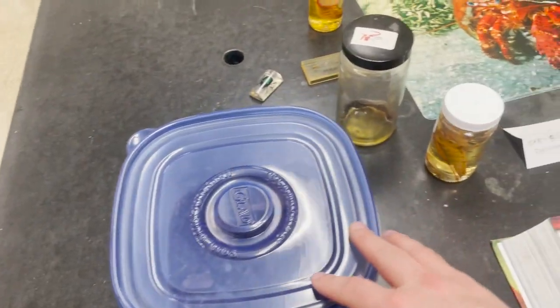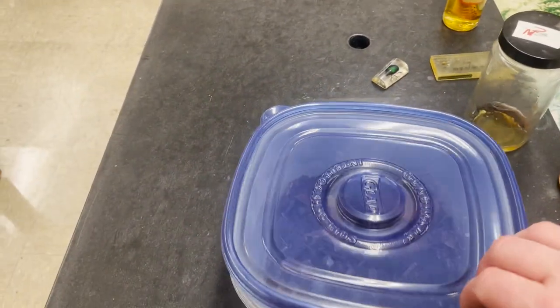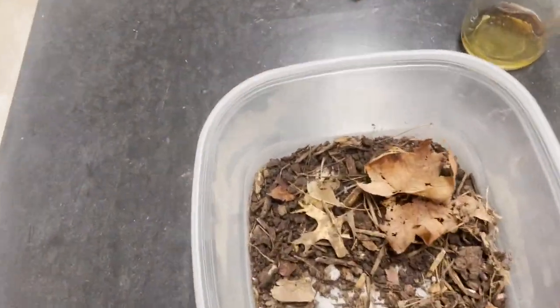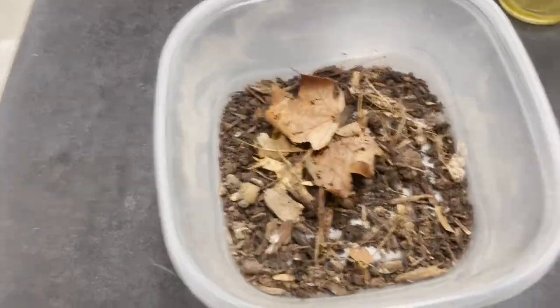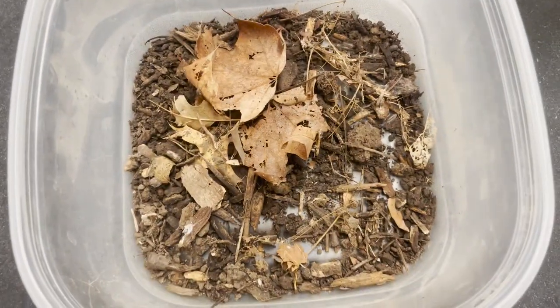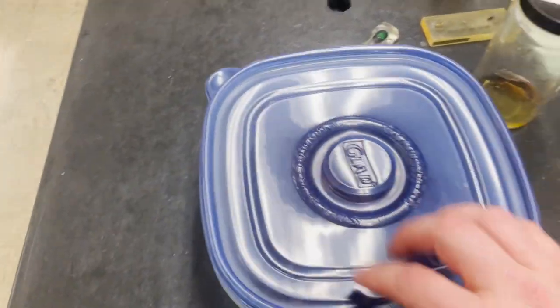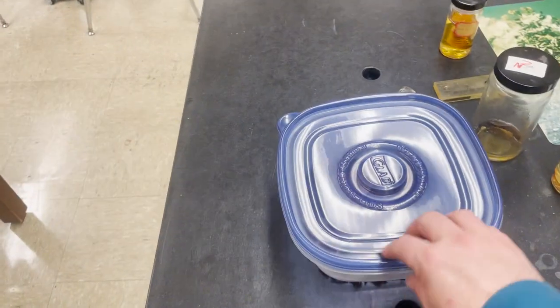This over here on the arthropod table, which is right here in the middle, you can open these. These have some pill bugs or roly polies, and if you give it a little shake just slightly back and forth you should be able to see some of them scurry about — so that's kind of fun. There are two of those on there. Those are the only closed containers that you can open. Please do not put the lid on tight; they need air, so just loose-lid it.